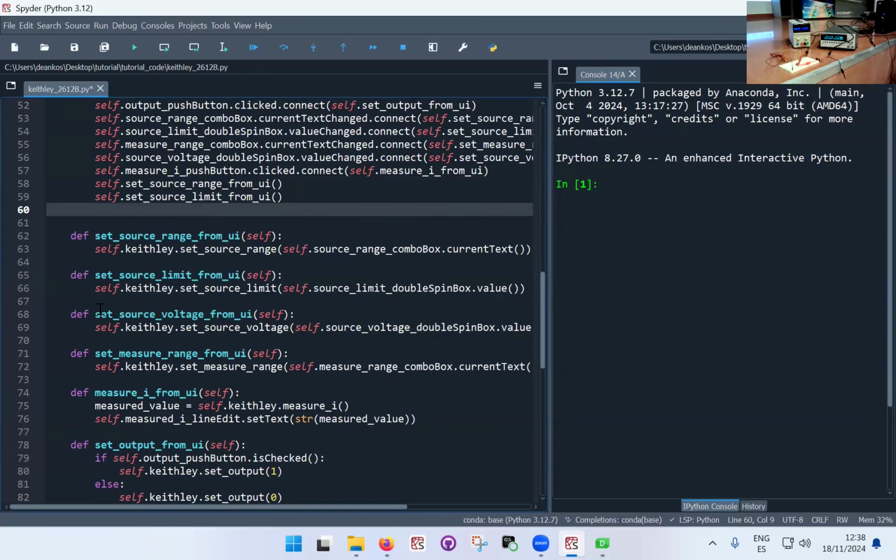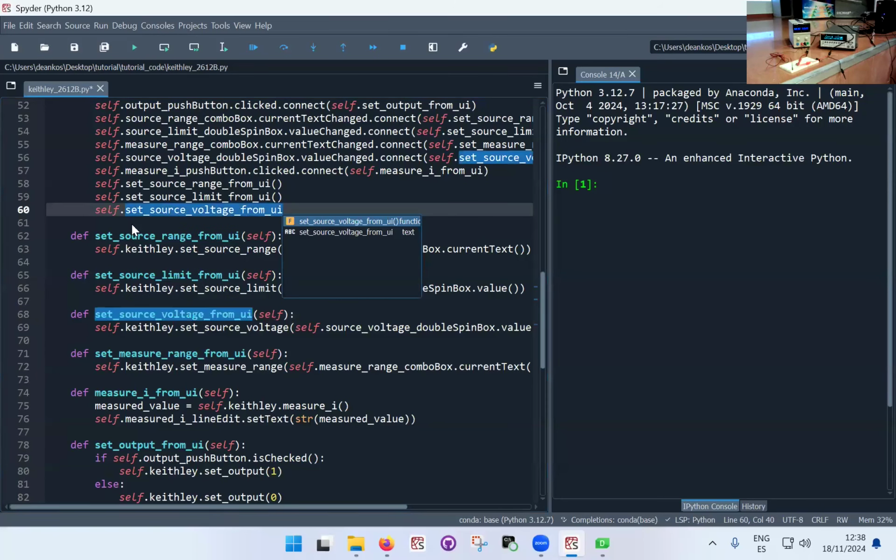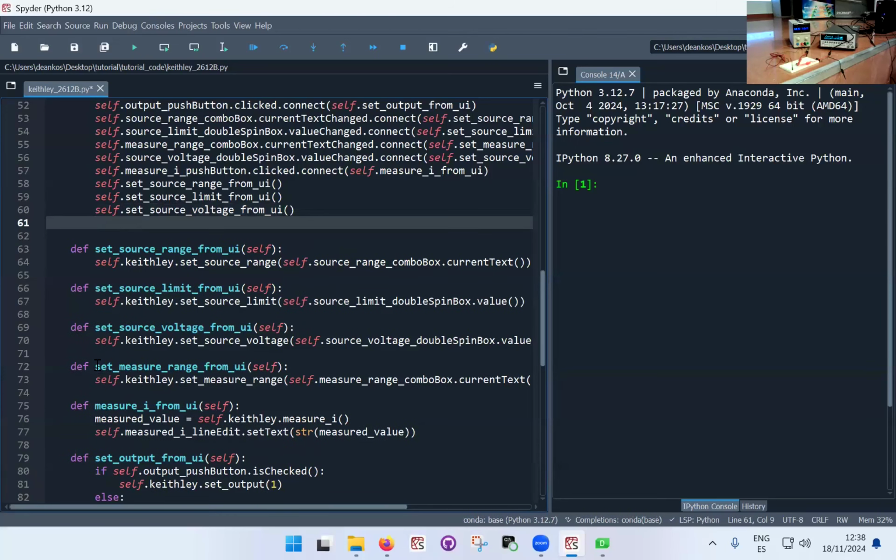Qt is quite flexible really. I could write some code to take all the widgets that are inside the user interface, take them in a programmatic way, and execute each one of them separately. But we're not going to get into that today.